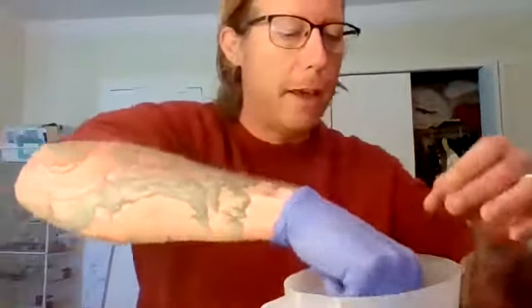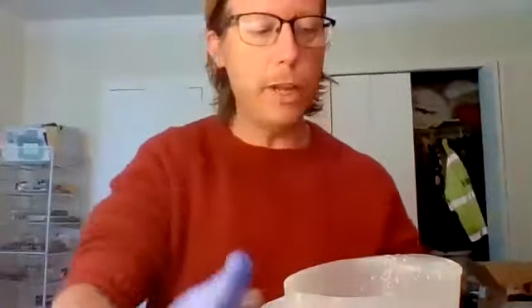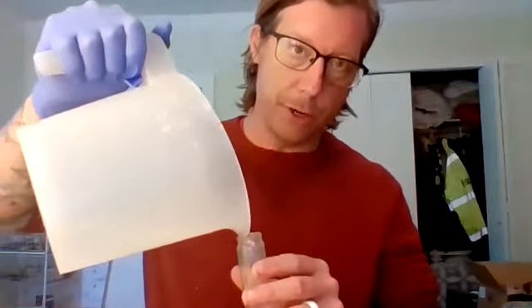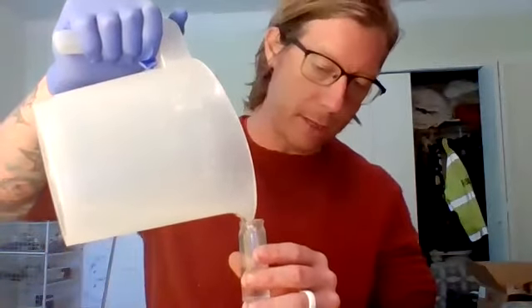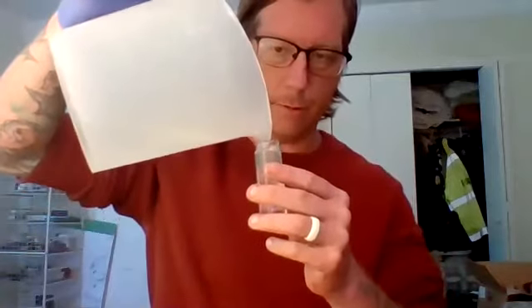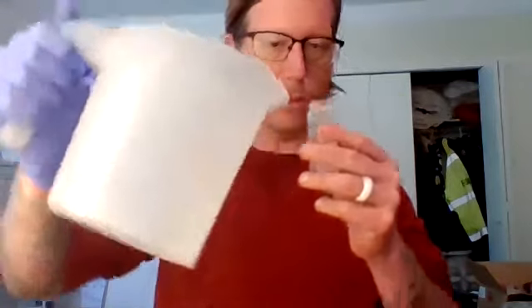Okay, I got my solution. I made it yesterday, so I know it's super saturated. First thing I'm going to do is measure out my liquid. So again, I've told you all we need, well, this thing will work, 28 milliliters of liquid in here. But we're going to need 30 total of material. We need 28 in here. So I'm going to fill this up to the 28 line. Okay, pretty simple so far, everybody. Obviously, if you go over, you can pour some out. All right, that's right on the 28 there. Perfect.